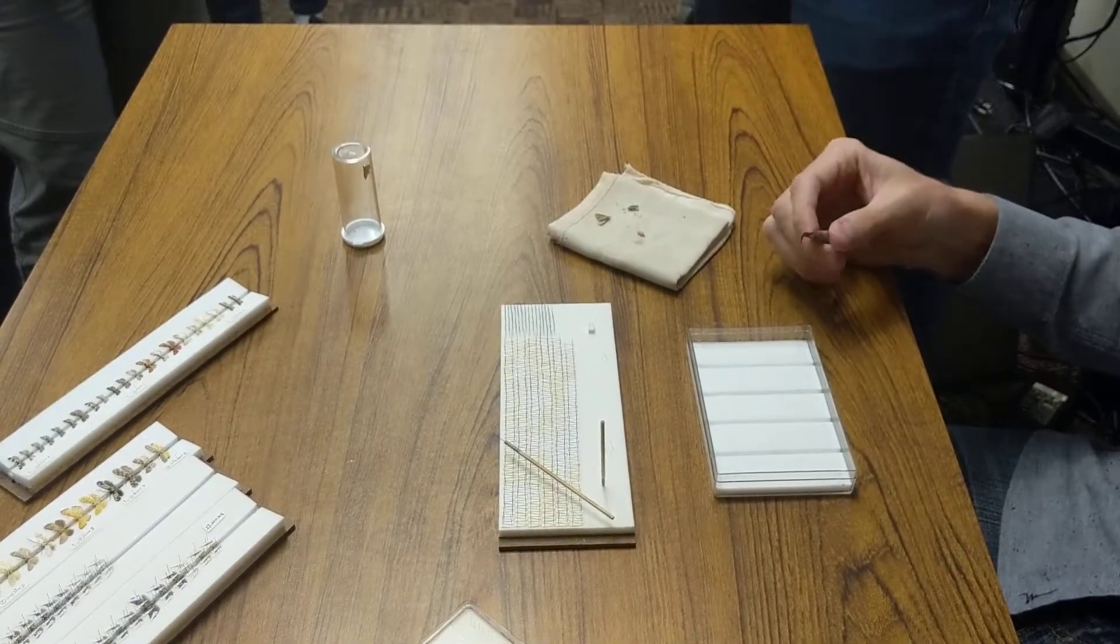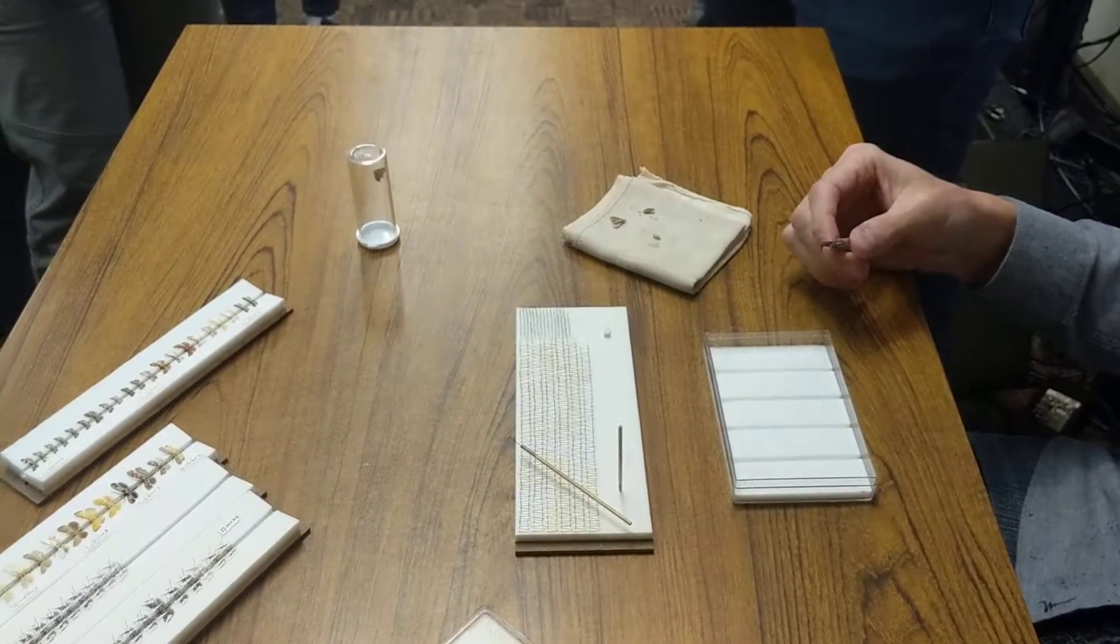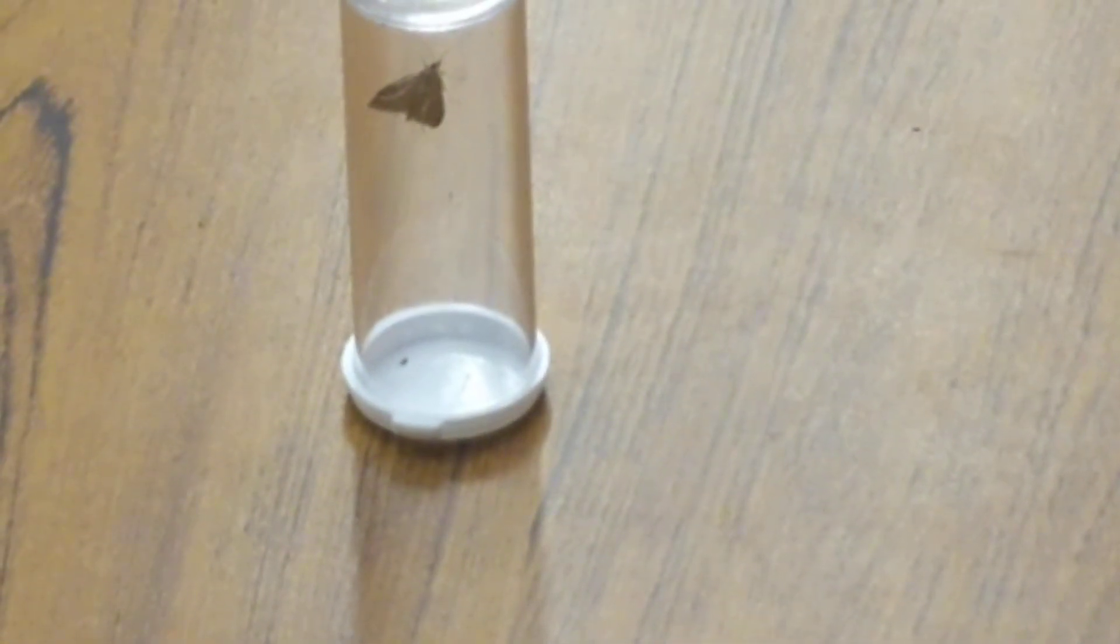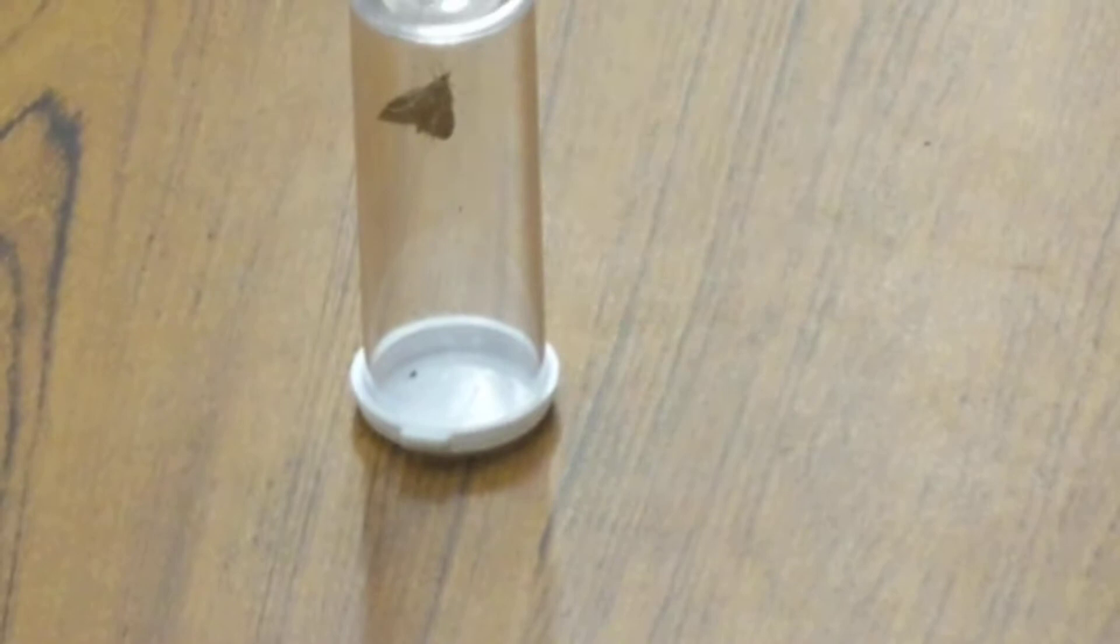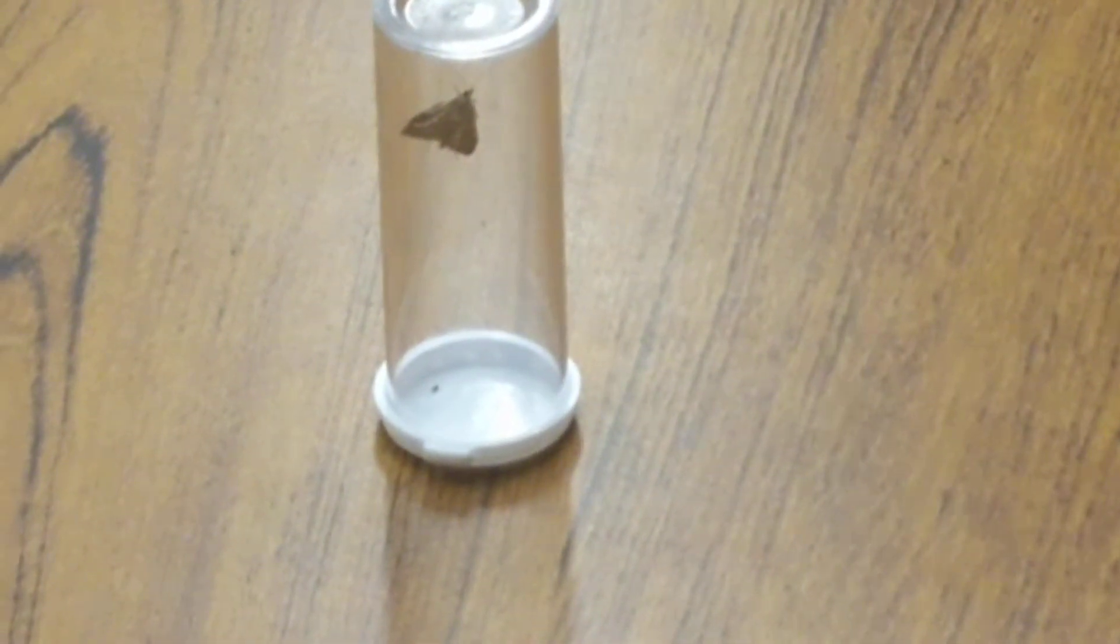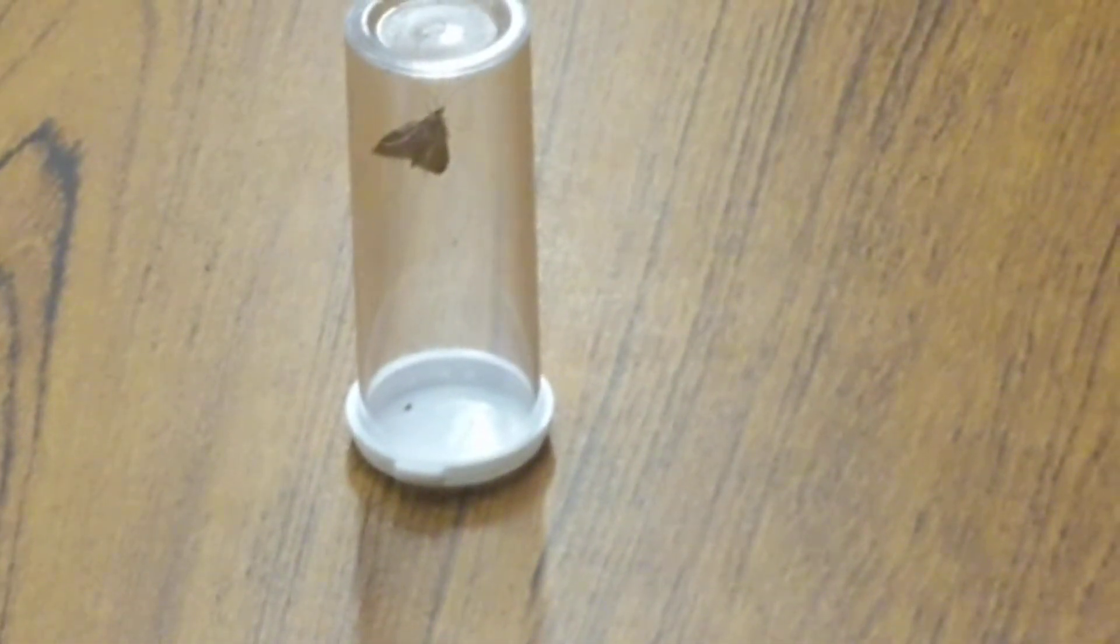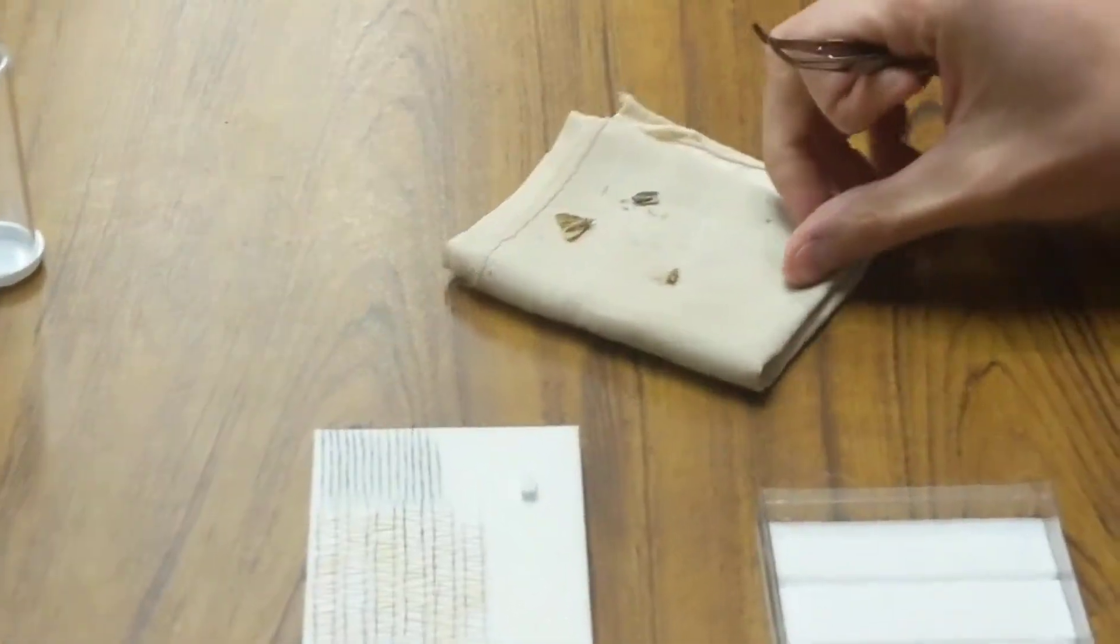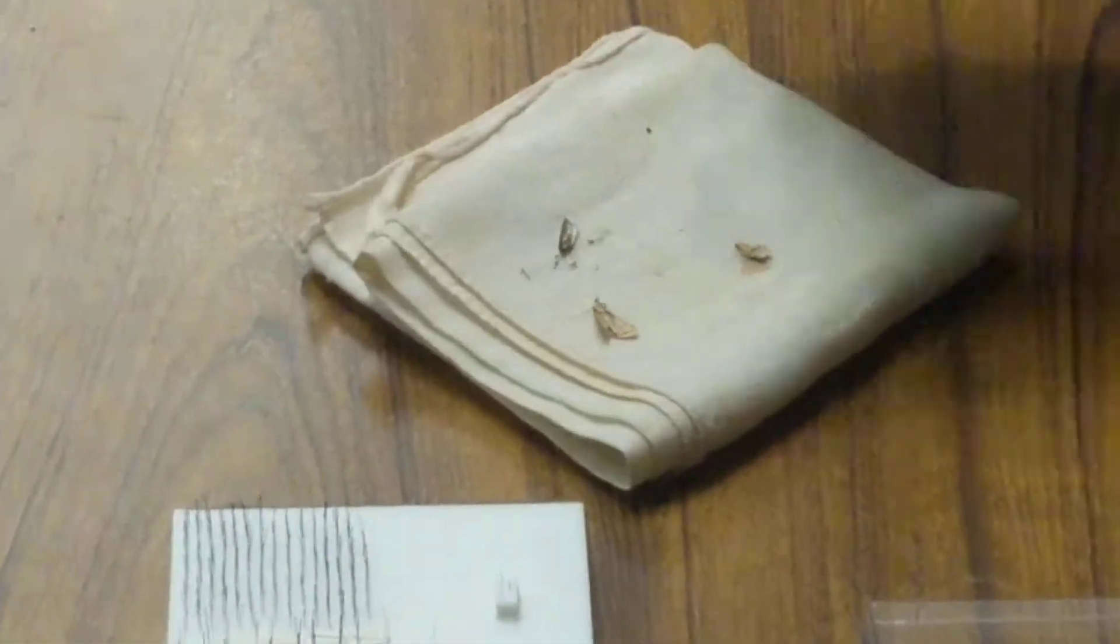Would you ever repin or is that—? Oh, yeah, definitely. If I took the specimen off and the pin's going like this, just put it back on here, get another pair of forceps and knock it off the pin and redo it. So this is a male Choristoneura rosaceana, by the way. This is a Clepsis.